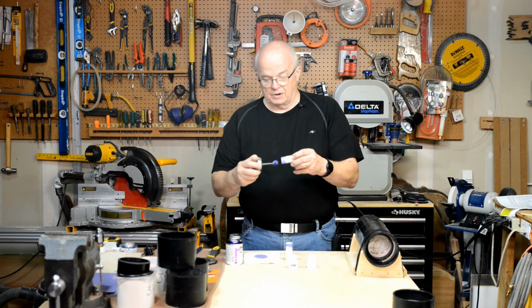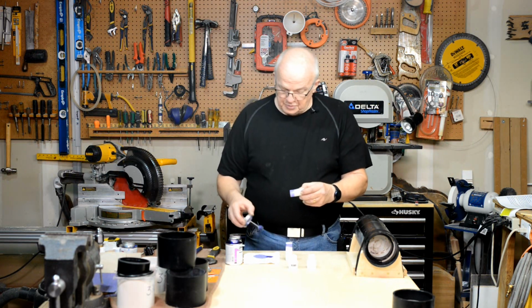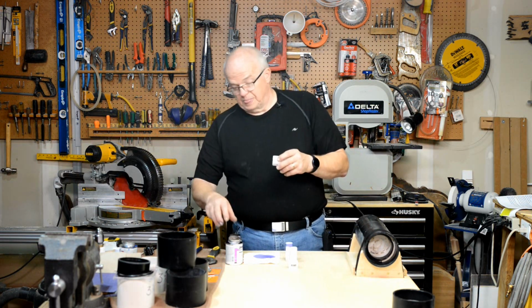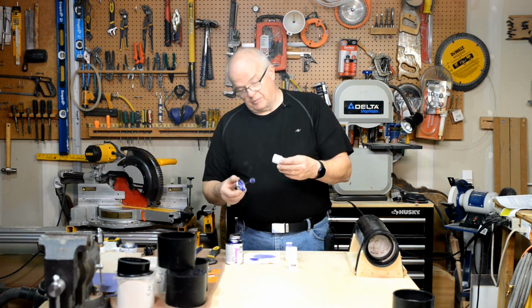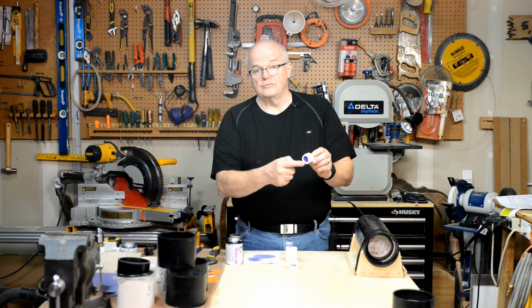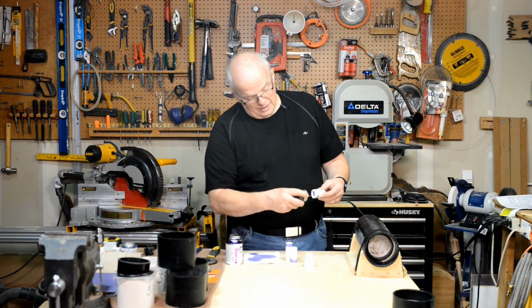Okay, and there's that one. This one's got something right on it here I want to scrape off. So, again, dab it onto the paper towel to control the primer. Now I'm going to put some primer in the adapters themselves. Take it out, touch the very end of it against that paper towel, and put primer in all the way back in. Try not to get any primer against this outside edge. That's going to be important later on, and I'll show you why. Primer inside of there.